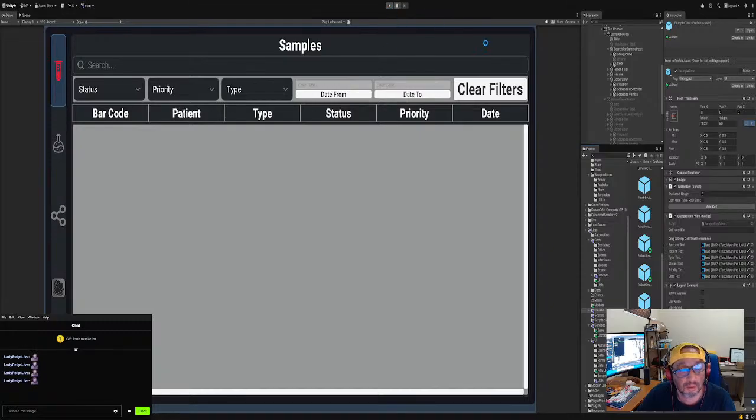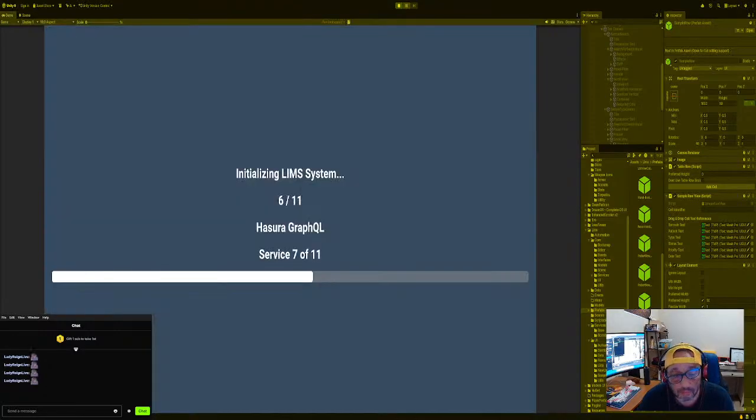Okay, come on, come on. Takes too long. Okay, there we go. I just want to make sure that we're using the right prefab. Oh no, I didn't have to do that. I could have just looked here. Sorry.